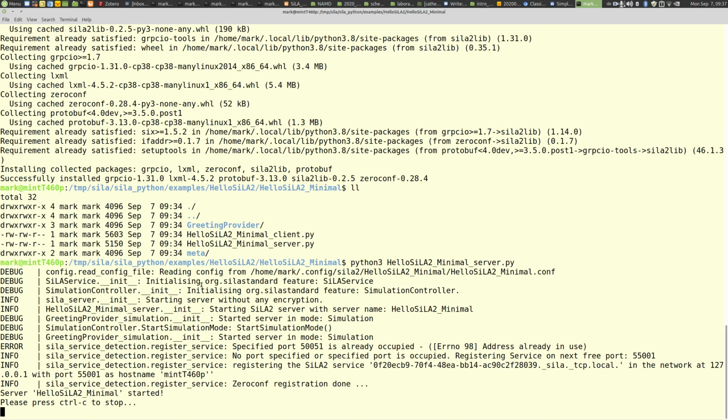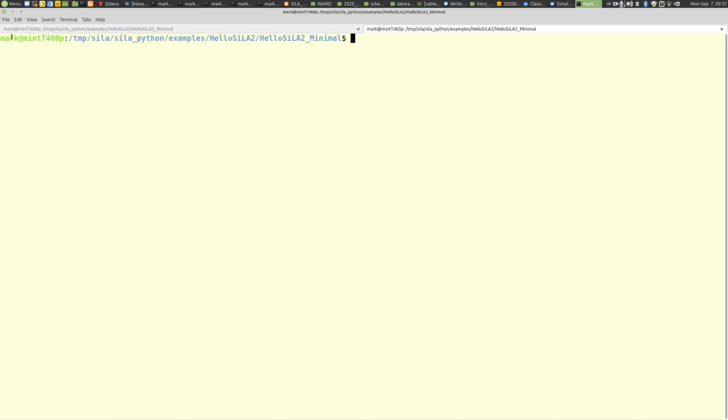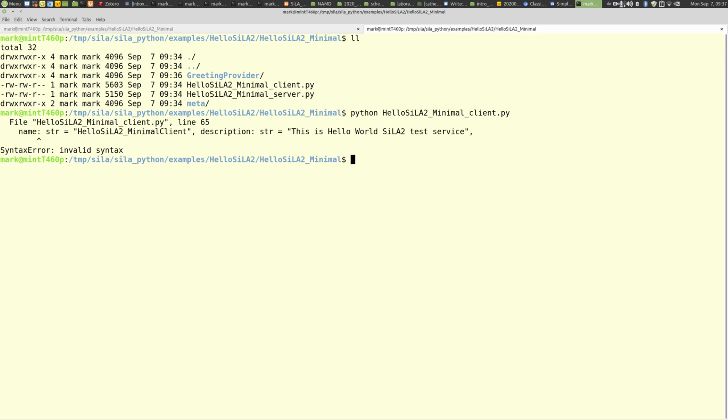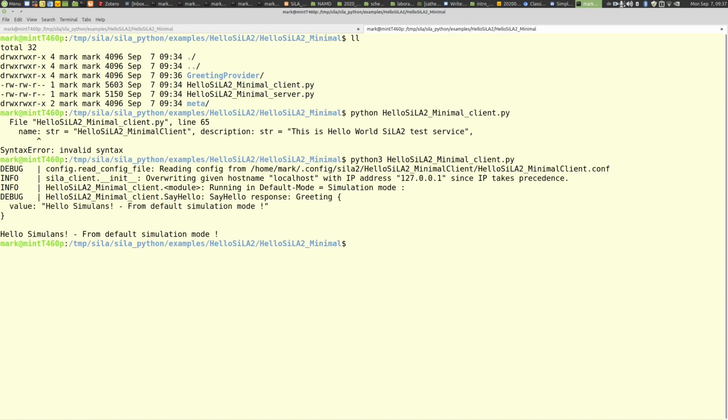It runs, it waits for a request or a command we send. And now let's send a command. For that we open a new tab, go into the same directory, and then start a client, python hello SiLA client, and start it. Sorry, you have to run it with Python 3.